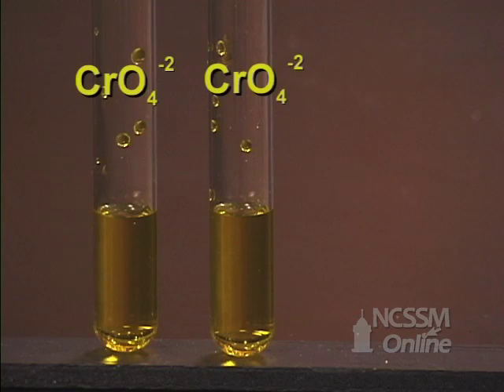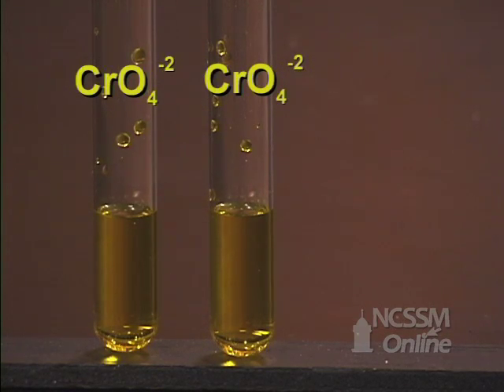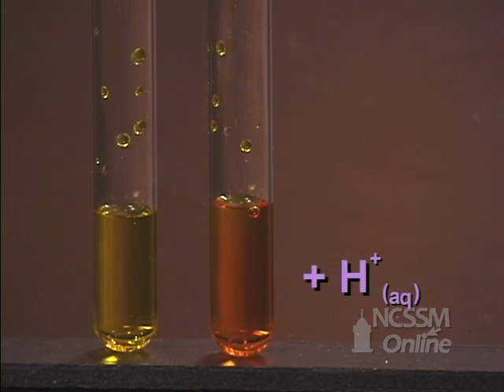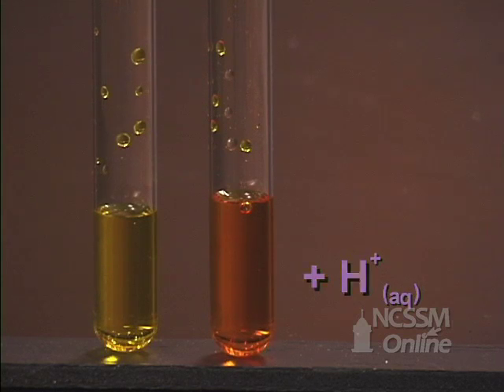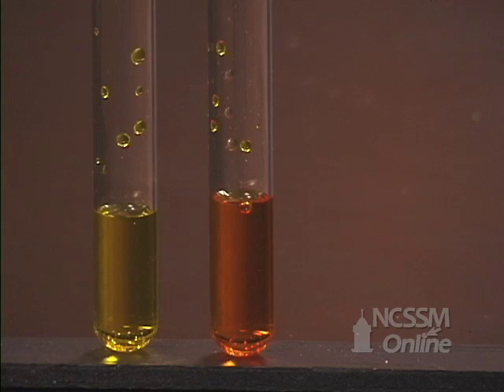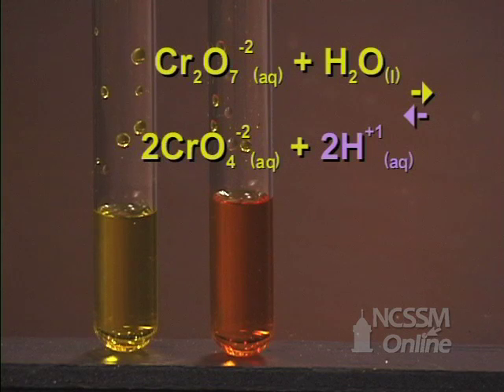We have two test tubes containing a solution of potassium chromate. We will add 6 molar nitric acid to one of the tubes. We notice that the solution turns orange. This indicates that the reaction has shifted in the reverse direction, from the chromate to the dichromate.